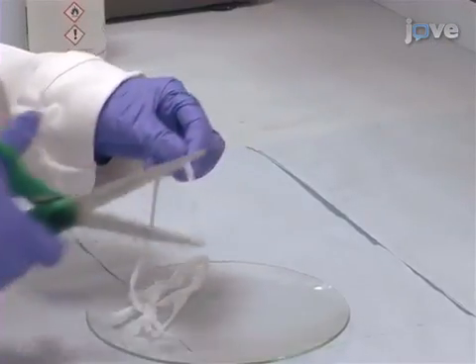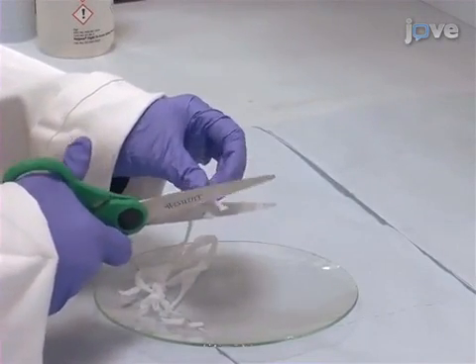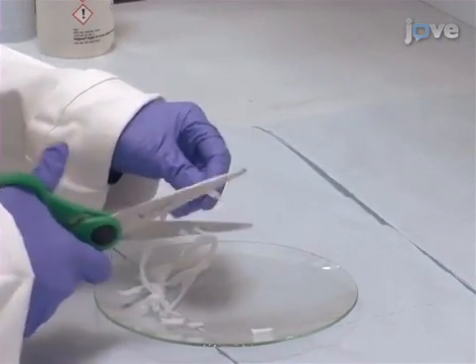Following this, cut the wet bacterial cellulose pellicles into small pieces of approximately one to two centimeters using a pair of sharp scissors.